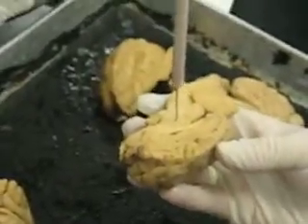Thalamus and hypothalamus. Let's see, I think it's this one here. All right, thalamus is right there. You can kind of see it's a big ball-like structure. And then the hypothalamus is lower. Hypo meaning below, so it's down in here. And it's a four-legged animal, so it's going to be in a little bit different position than it is for the human.